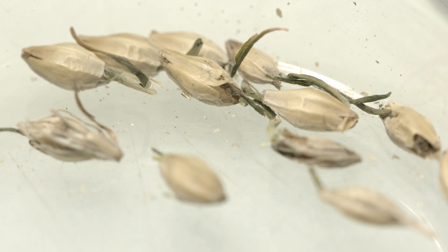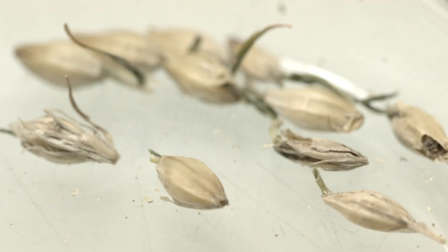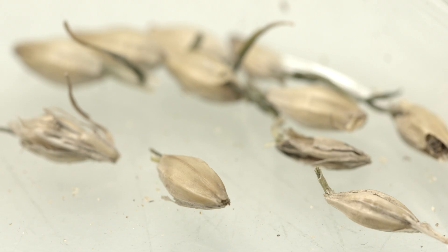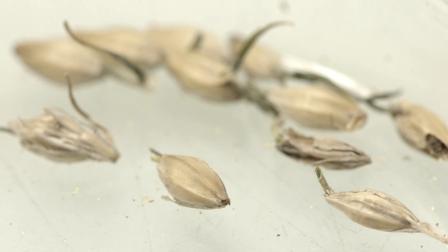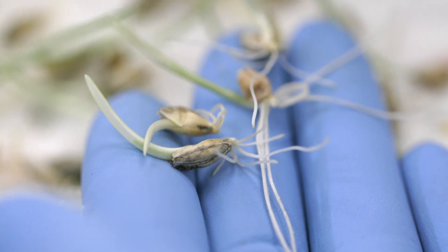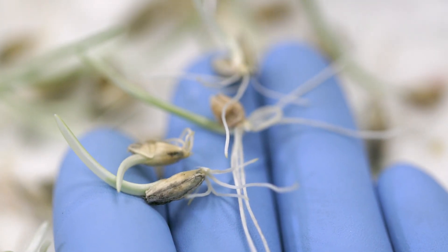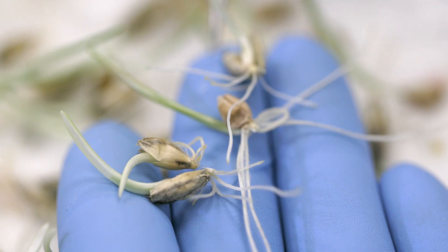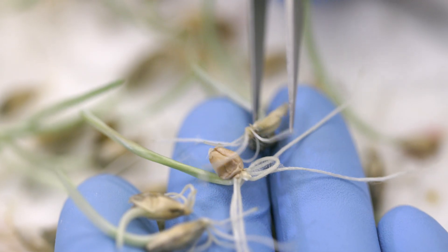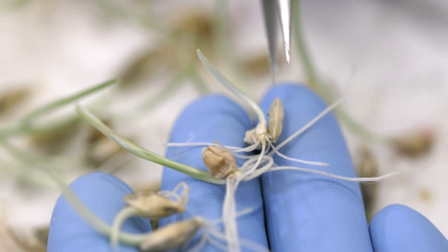We also have seeds that appear to have germinated but have died during the test. These are sprouted or chitted grains. Sprouted seed has been swathed and subjected to poor environmental conditions during dry down and curing. Unfortunately, sprouted seed affects quality — it leaves the grain spoiled as the germination capacity has been lost, because much of the enzymes necessary for growth have been used up.